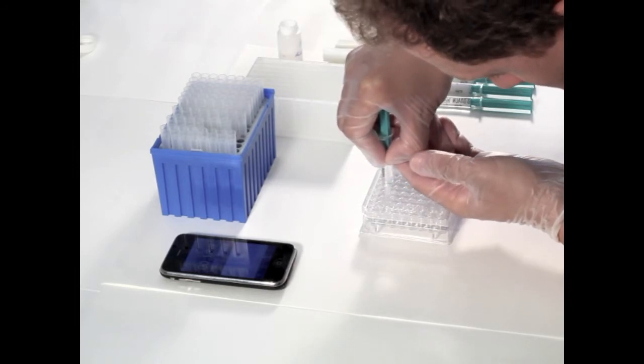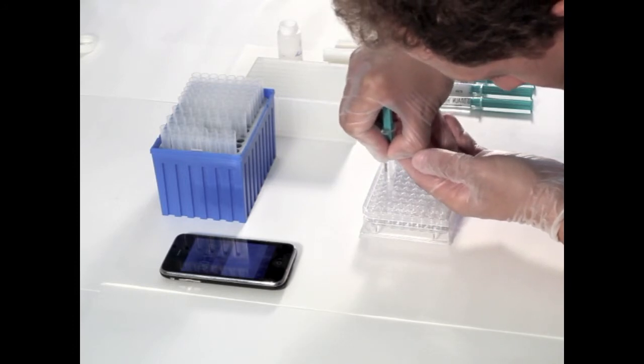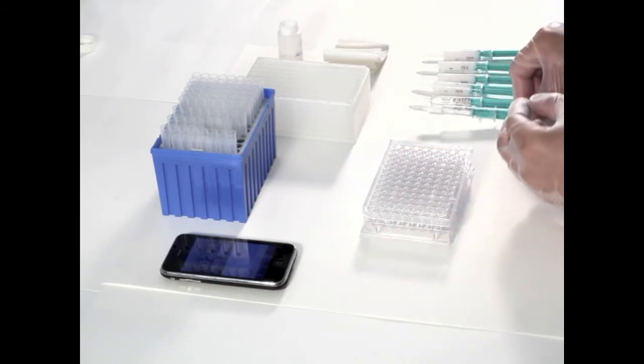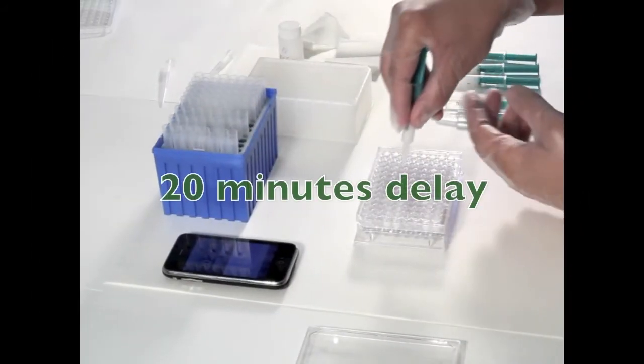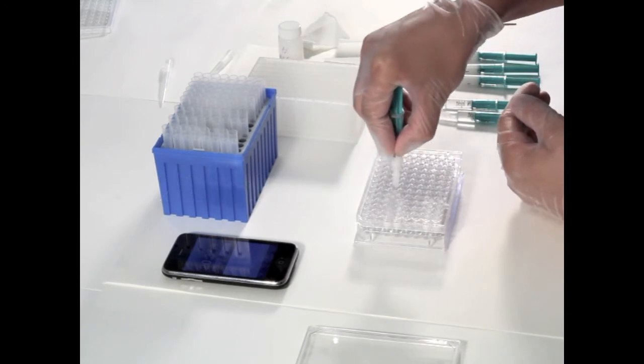It is possible to execute both single and multi time point assays. This video demonstrates a 3 time point measurement with 20 minute incubation intervals.